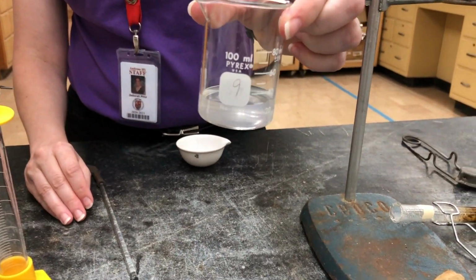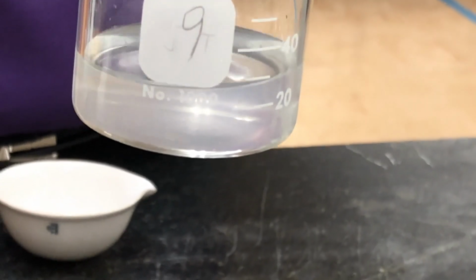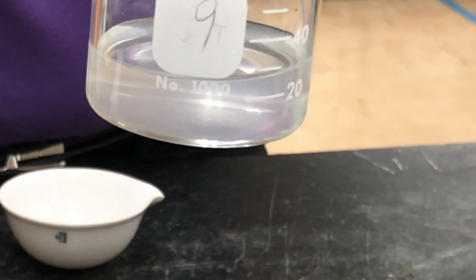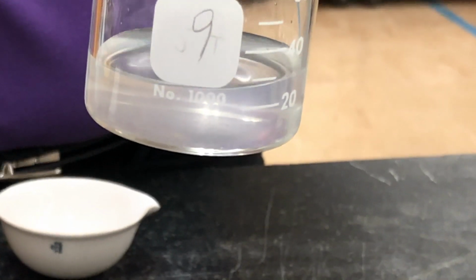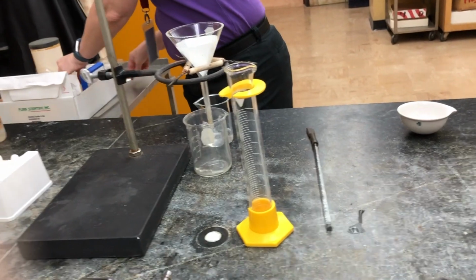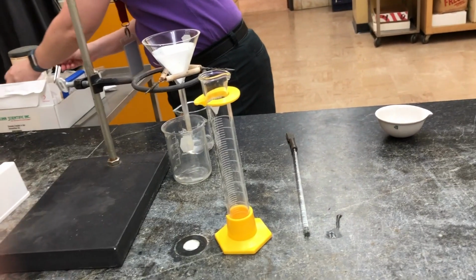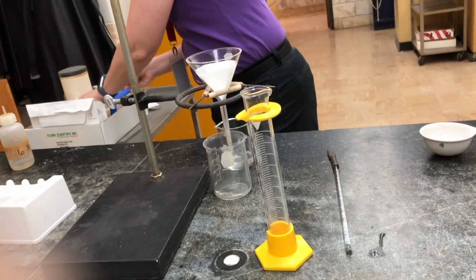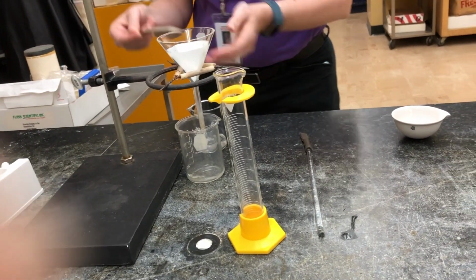Get a good look at that. Then we're also going to mix some sand into here. Stir that up.